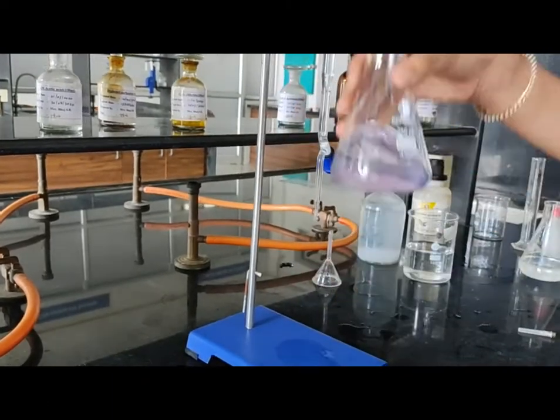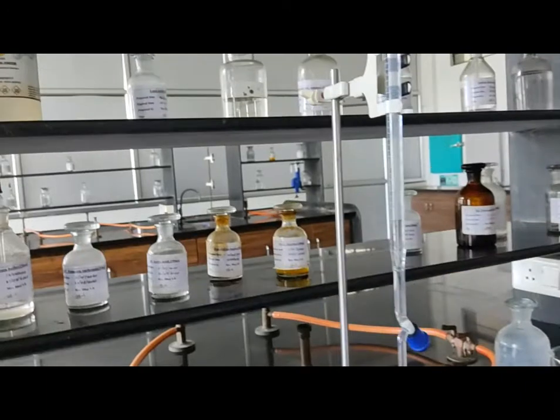Now this is our endpoint, colorless to pink. The burette reading is 23.9.